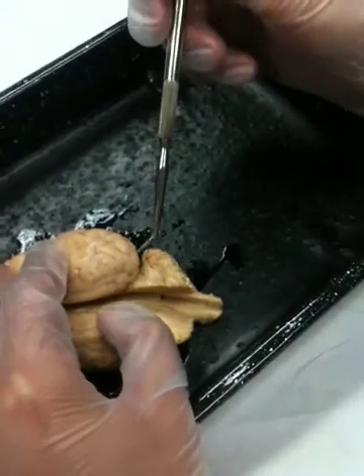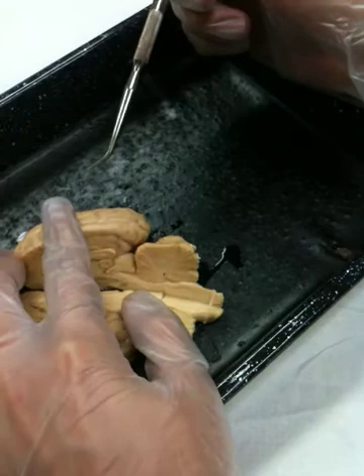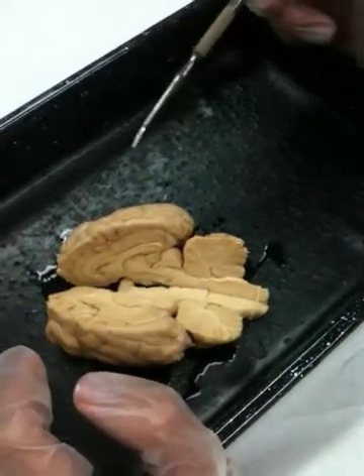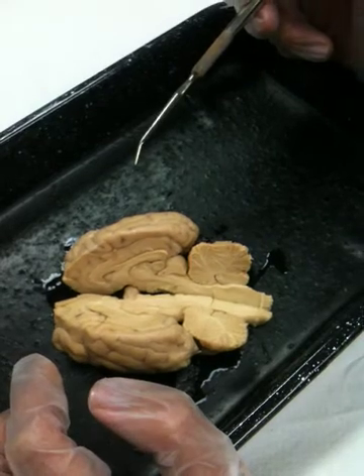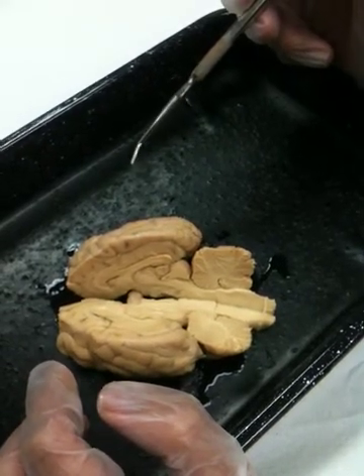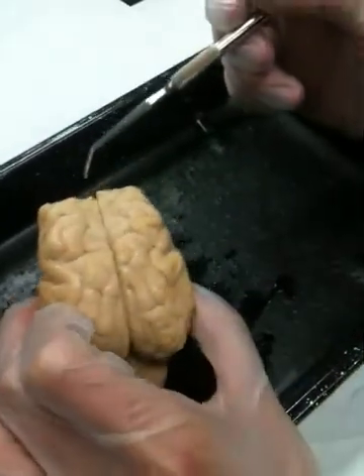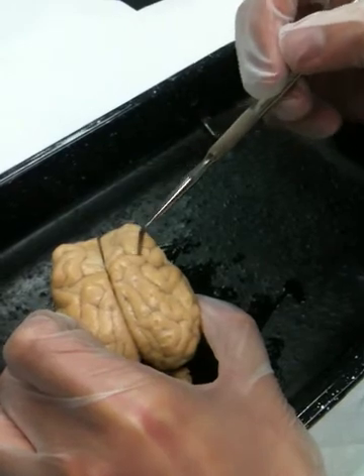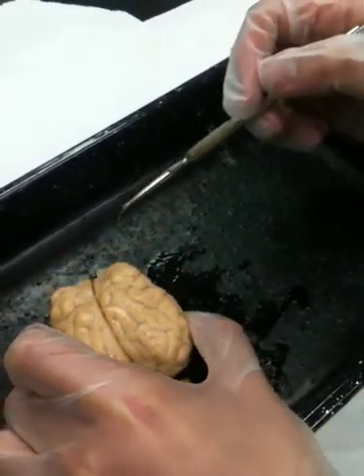There's also a central fissure, which is a little difficult to see on a sheep's brain. It's a structure which is pretty remarkable on a human brain, but on a sheep's brain it's kind of indefinite. But basically it's a dividing line between the frontal lobe and the parietal lobe. On this brain, our central fissure would be right along in this groove, not as deep as the other fissures. In addition, from the outside, we can see the pons and the medulla.